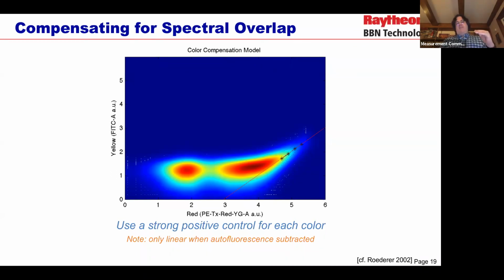So what we should end up seeing is that at low levels, it's flat because you're being dominated by autofluorescence and instrument noise. And then as you get to high levels of fluorescence, if there's a significant overlap, it's going to show up as a diagonal line with slope 1 coming up out of that bottom. In this case, we're seeing this diagonal line coming up here, and it's showing that we've got about a little more than a 1 in 1,000 spillover. So this is a really pretty low level. We want to make sure it's less than 10%. I usually recommend keeping to less than 3% if you can. But often you can get combinations, like from the fluorescent proteins that the measurement committee recommends, that are extremely low indeed.